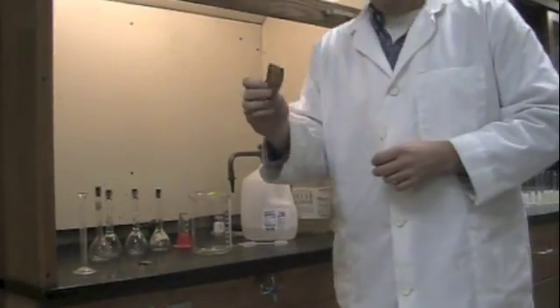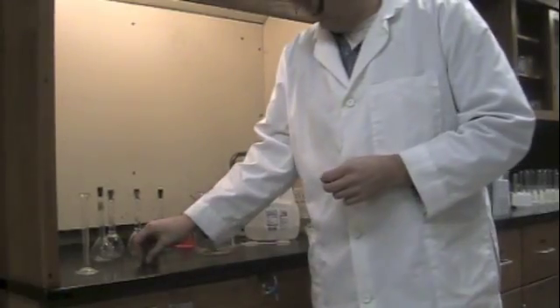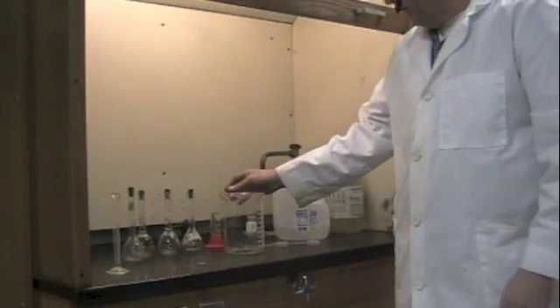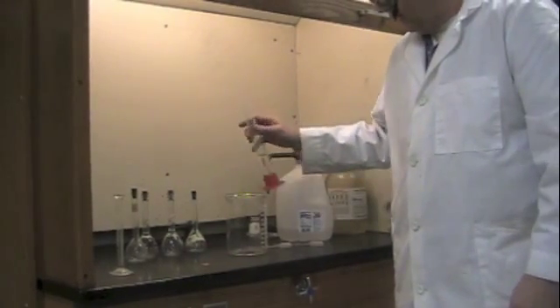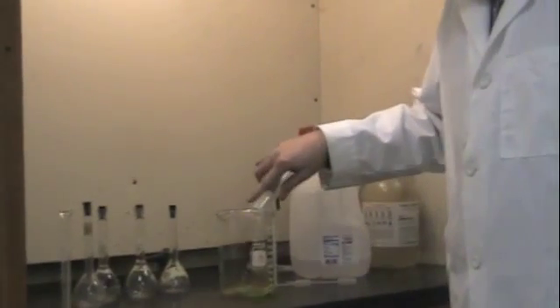To do that we're going to put a piece of pure copper into a beaker and I believe there's about 10 grams of copper here. Then we're going to add to that some nitric acid and what will happen is the copper will react with the nitric acid and the copper will be dissolved. As you can see it makes a toxic brown gas and so we're going to want to turn on the fume hood for that.